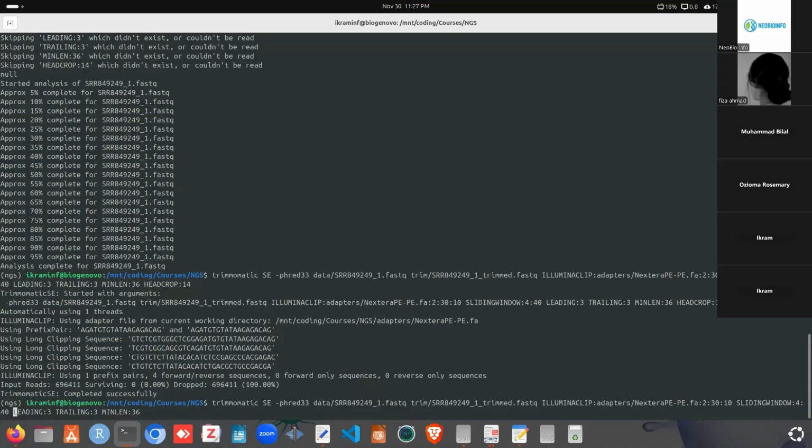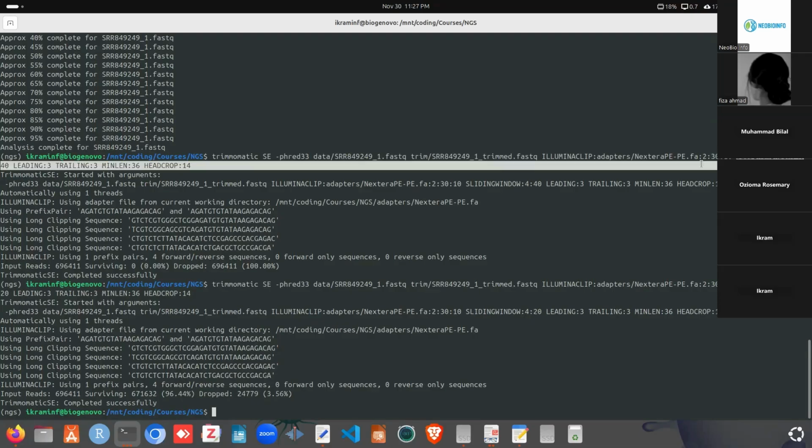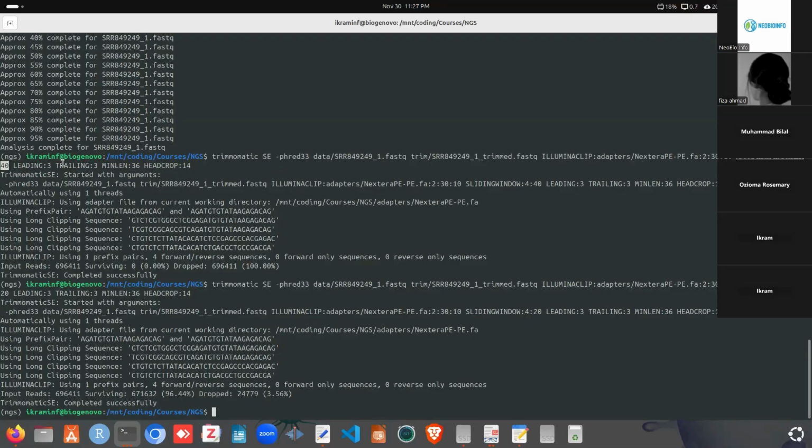Here we used 40, that is too high as a quality score. So that was the issue. For the sliding window, we specified the average quality score as 40, and it dropped all the reads. So 40 as a quality score is very high. After lowering the quality score to 20, it dropped 3.56% of reads and 96.44% of reads survived.